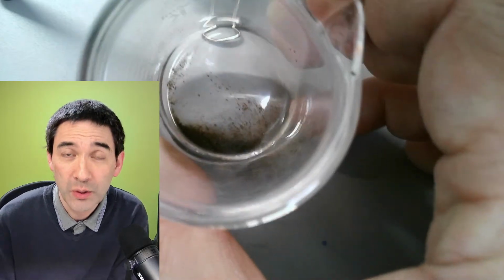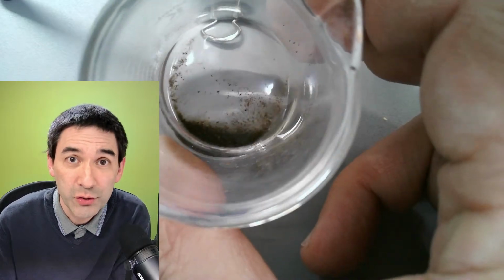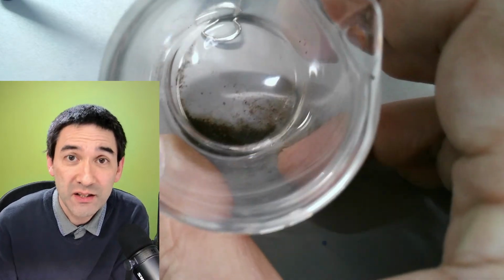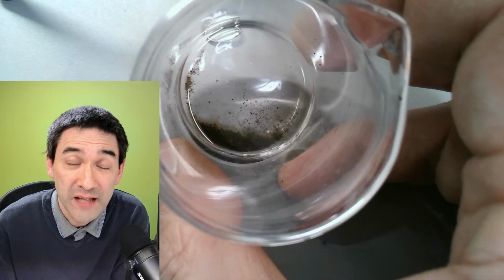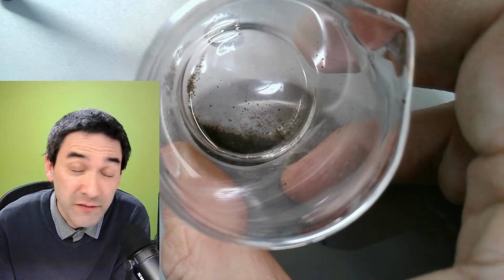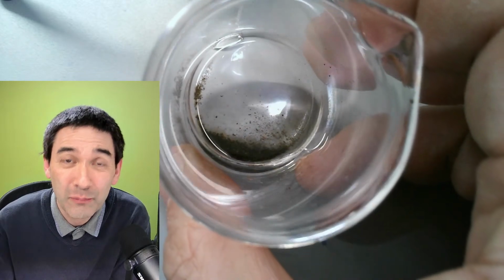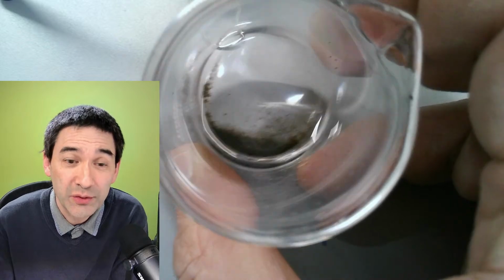The Baerman funnel was developed in 1917, and so it's over 100 years old already. And Mr. Baerman, he was a parasitologist, so he studied parasites, and he used this method to collect samples from soil and from other decomposing leaves, maybe of solid material in any case. And it's still used today. And as a matter of fact, if you just Google online or on YouTube, you can find several tutorials on how to set up those.